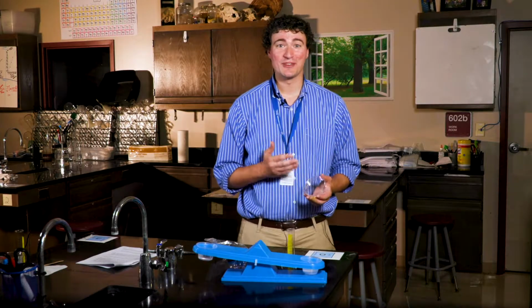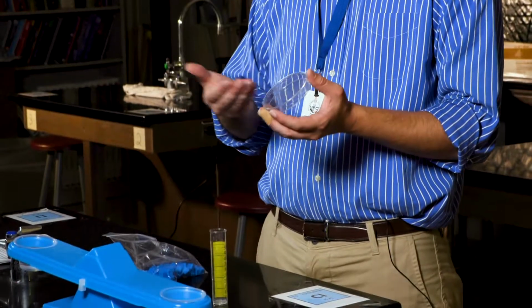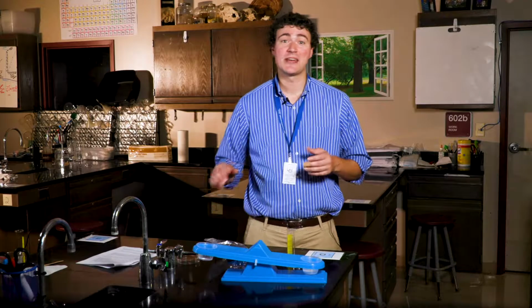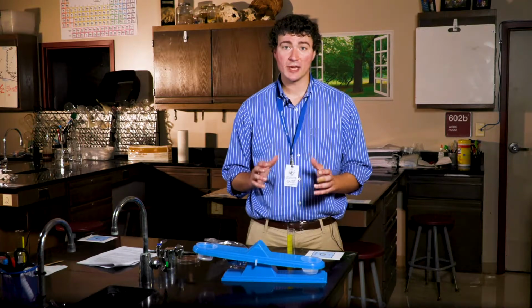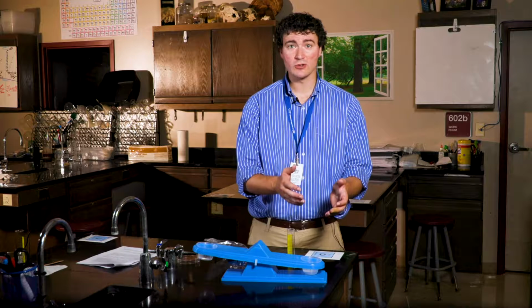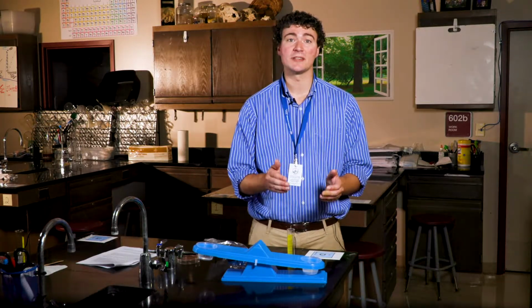And end the lesson by having the students pour some of their solutions onto evaporating dishes, so the solution evaporates by the following day. The big idea of this lesson connects to Standard 5.PS1.2 by having students recognize that the mass of a solution is equal to the sum of its parts. By measuring the mass of the saltwater solution, students obtain further evidence that the salt is still present in the solution.